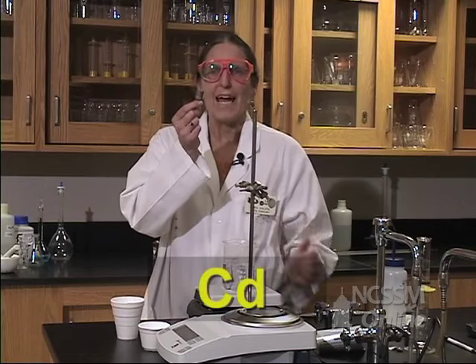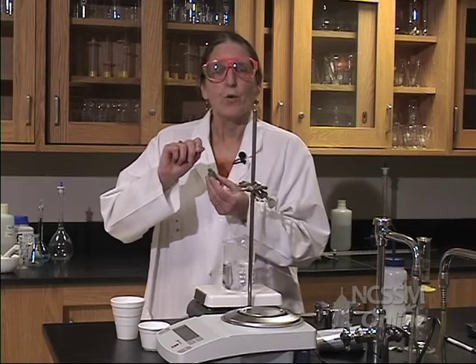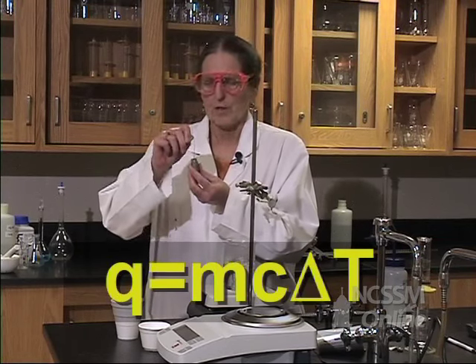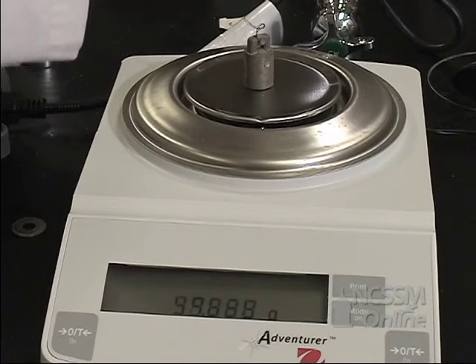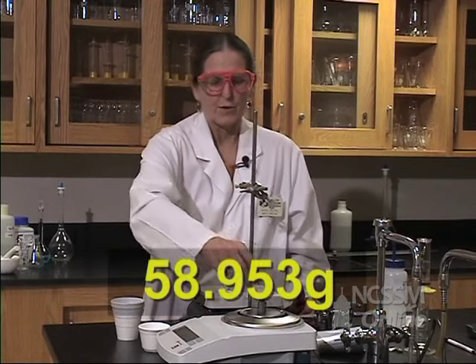We have a piece of cadmium metal and we're going to try to find out the specific heat of this metal. We know that the quantity of heat is equal to mass times the specific heat times the change in temperature. So let's start by finding the mass of our sample. The mass of our sample is 58.953 grams.